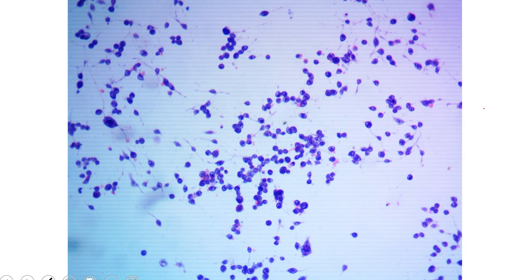Here's one that is a little bit harder to figure out because it has these projections. This is a neuronal culture, so you have processes from those neurons. You have the cell bodies, and then you have the processes. So it's a little bit different to figure out. In this case, you want to focus just on the cell bodies and not the processes when figuring the confluence. You're not thinking about these processes that are covering the cell surface area, or the area of the vessel. Rather, focus on the cell bodies only. If you look at just those, it will be a different number than if you include the processes in your measurement as well.